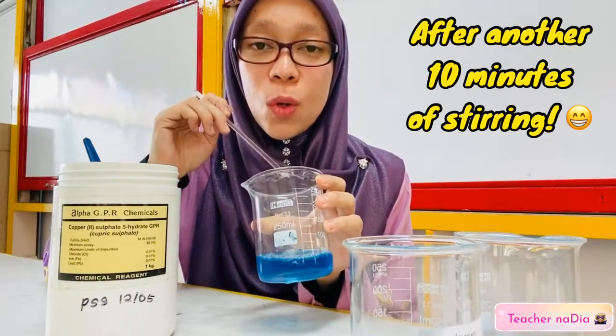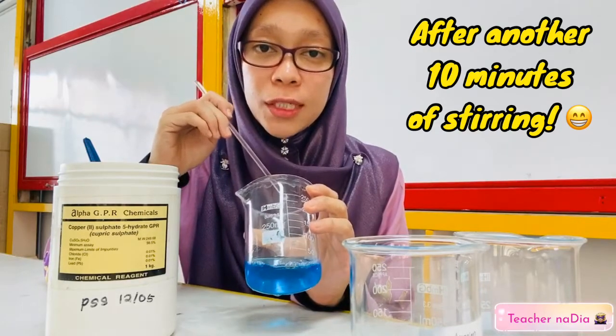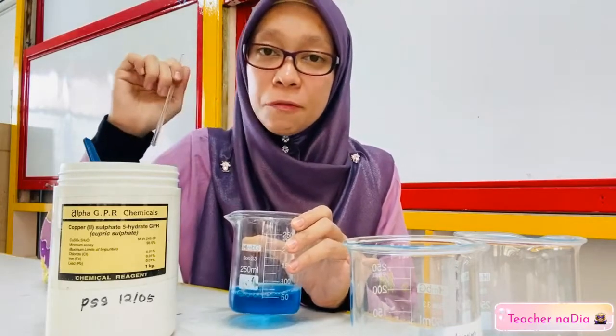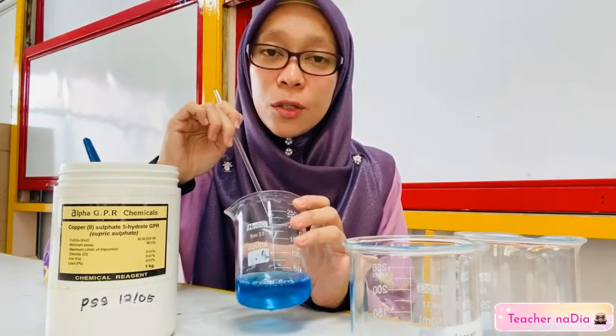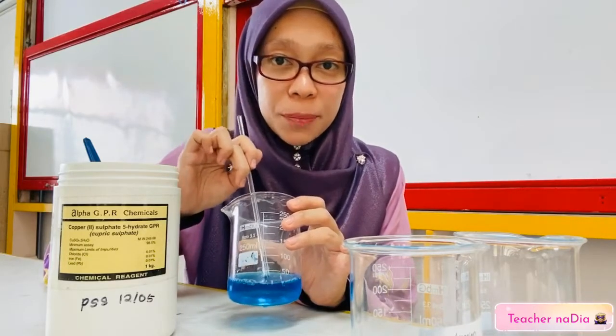If you can see, all the copper sulfate crystal has been dissolved in the distilled water. So we're going to add copper sulfate crystal little by little until we can see excess copper sulfate crystal deposit at the bottom.